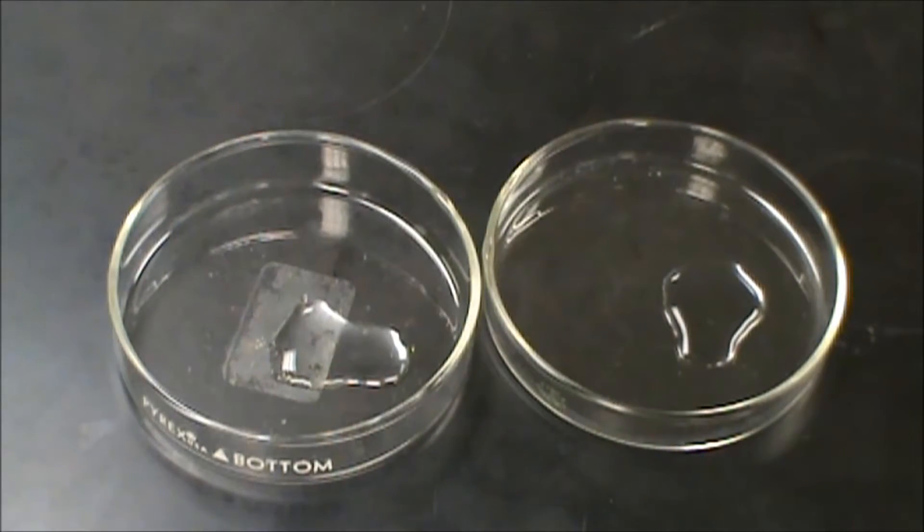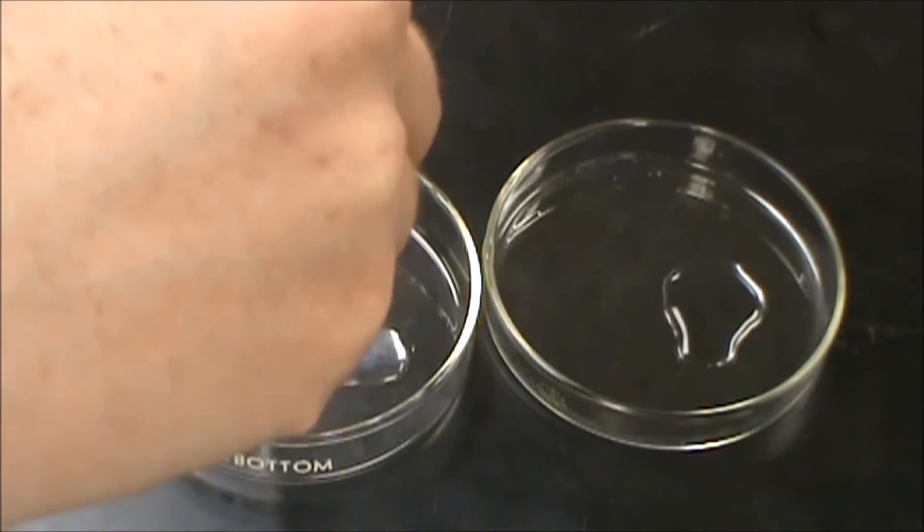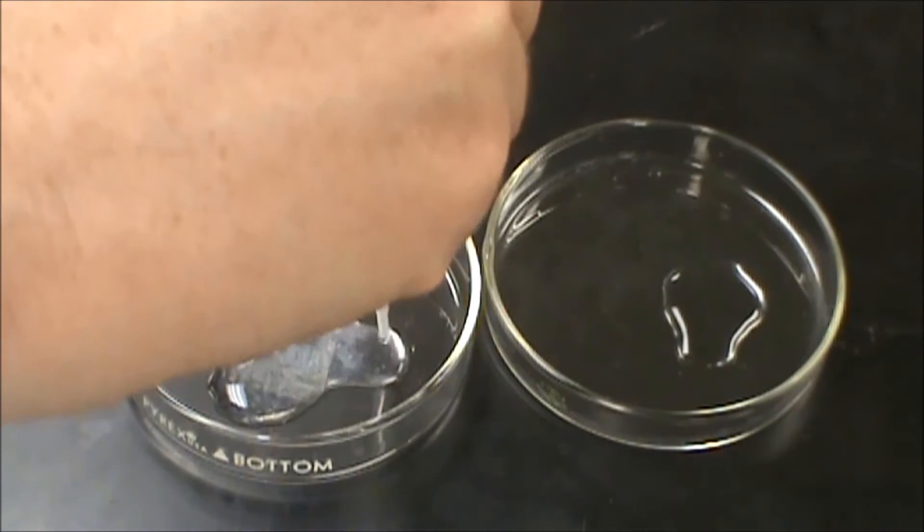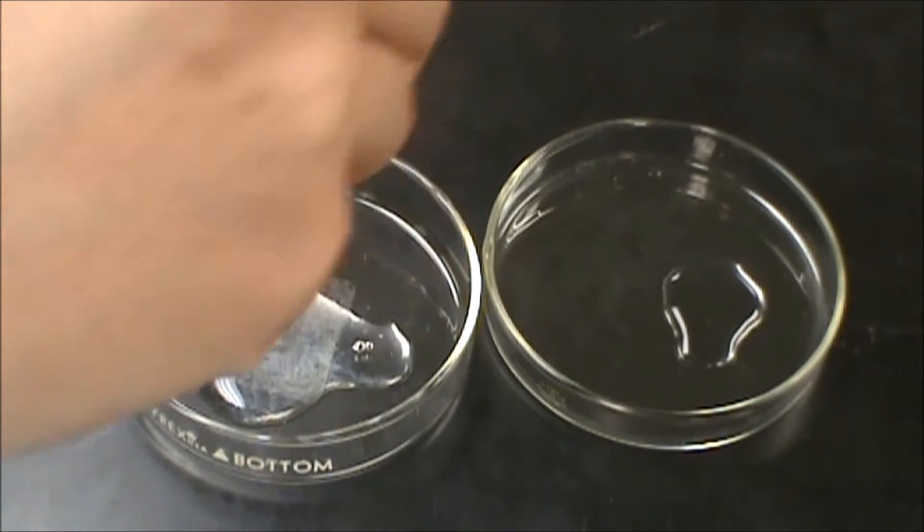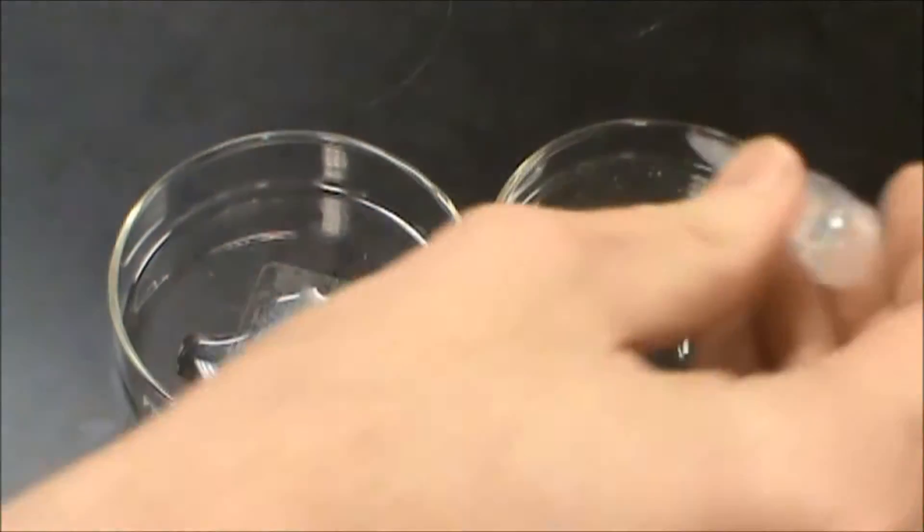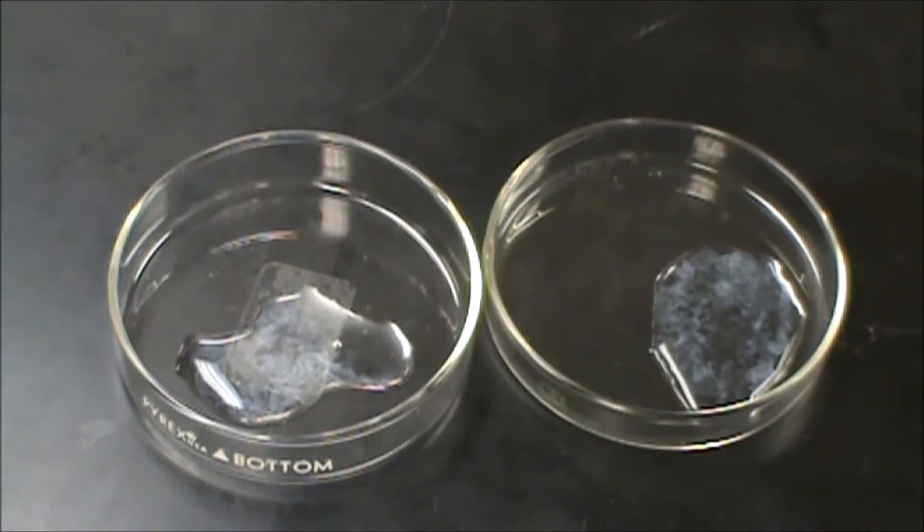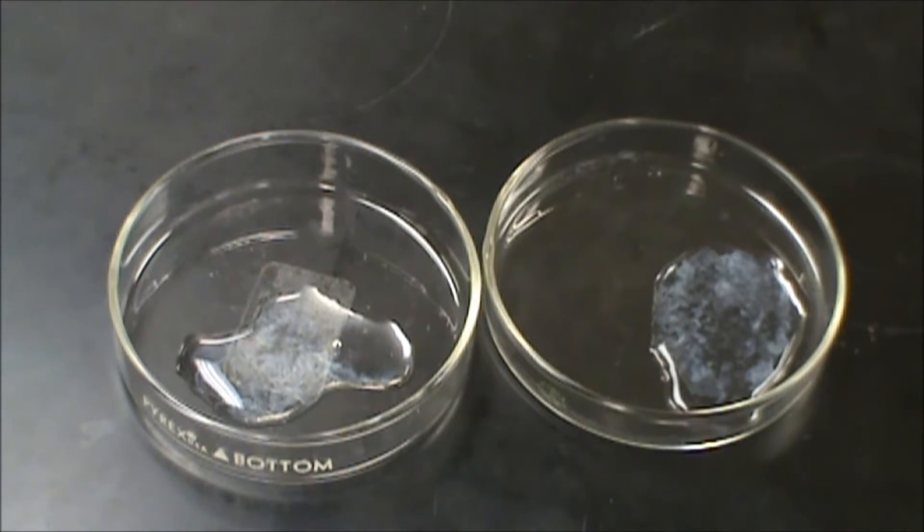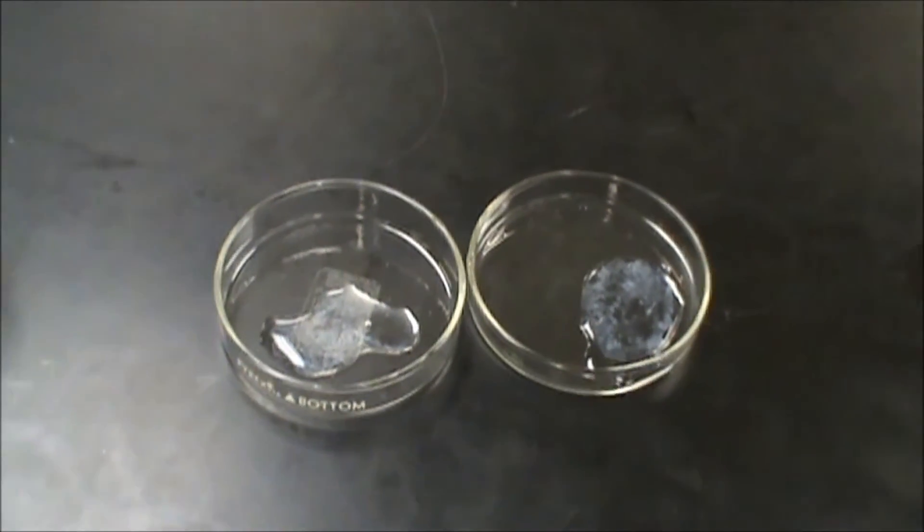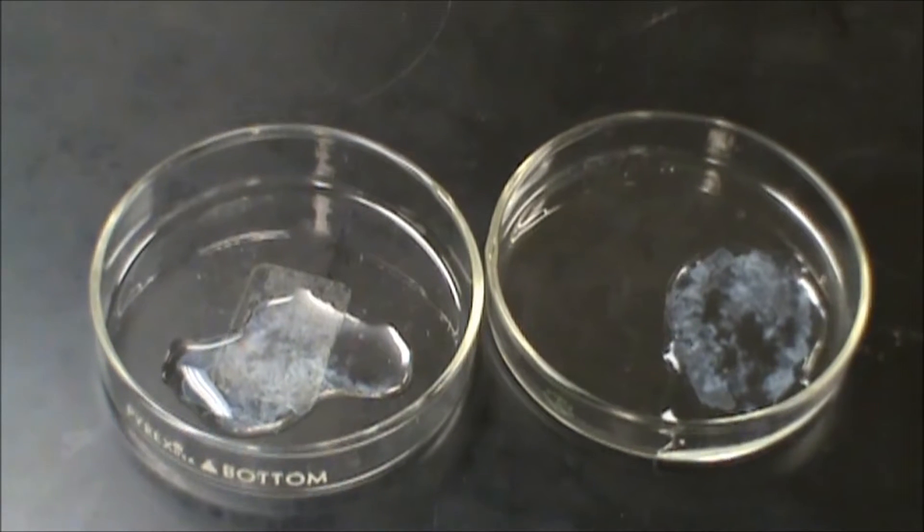So the first thing I need to make my compound, so I'm going to add some sodium hydroxide to that. And as I add that, you'll see a white precipitate form, kind of looks like a ghost or something spooky. So we now have zinc hydroxide in both of those. And that little fuzziness there you're seeing is the actual chemical.